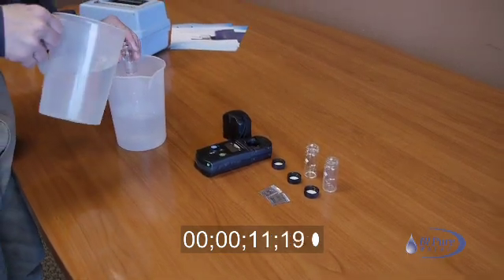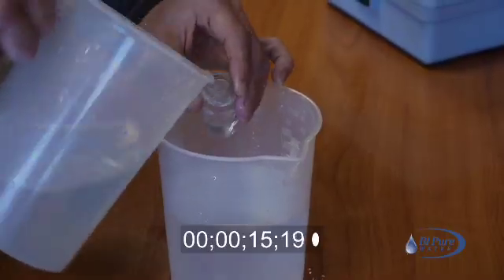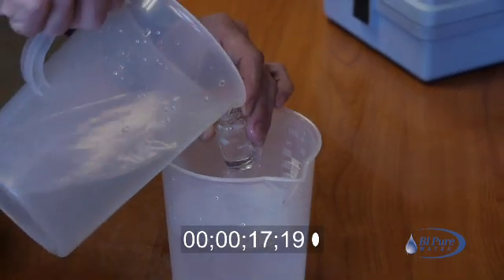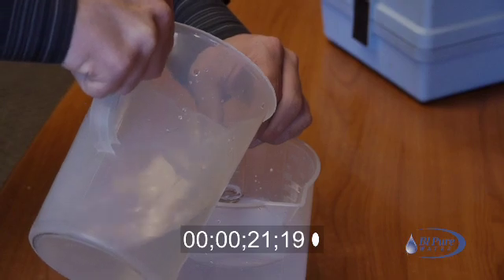To proceed with the chlorine testing, you first need to rinse the cuvette three times with the sample water. Then fill up to the line.